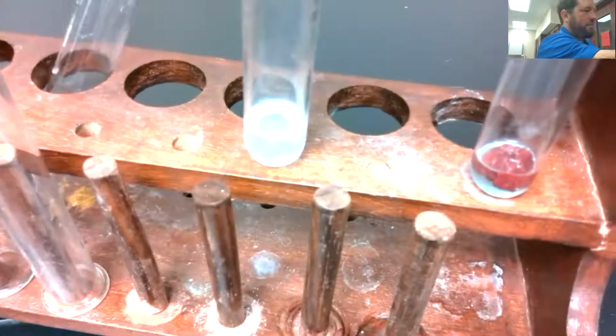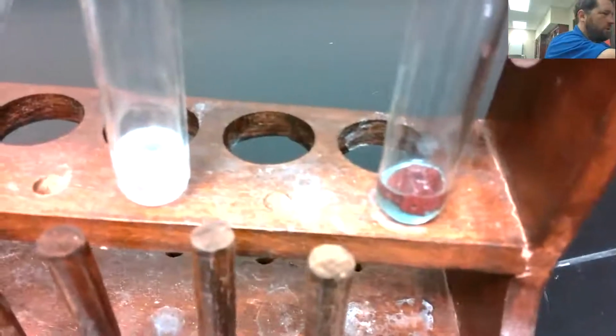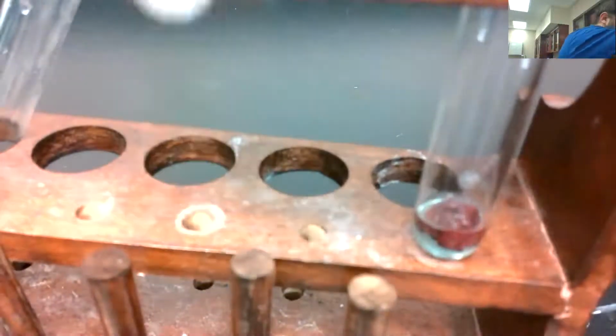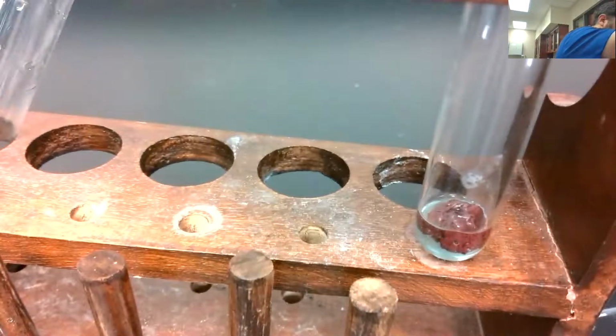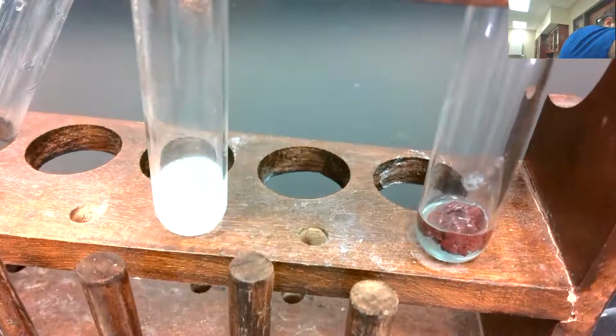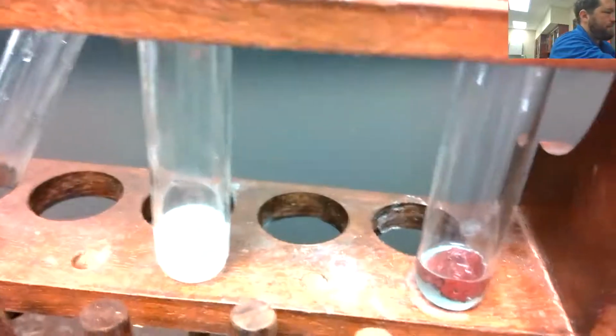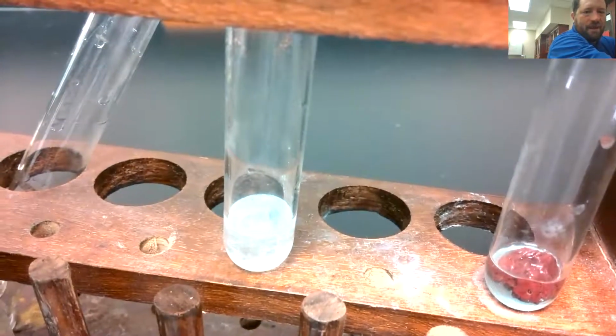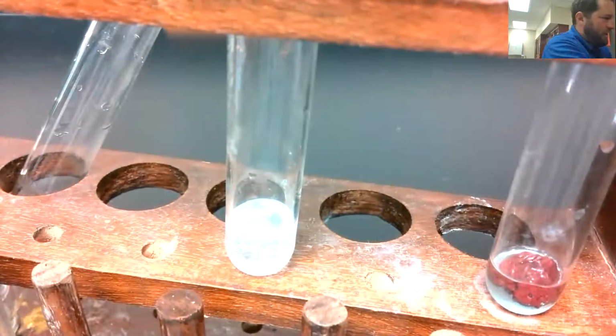Let me finish there. I can help you on question B of reaction 2 there. What happened to that magnesium? Well, look at that big long piece of it. Look how much is left. Not much at all. There's very little magnesium left.